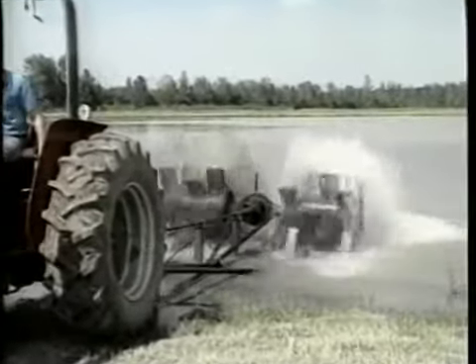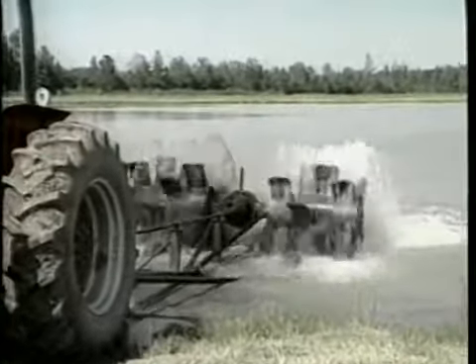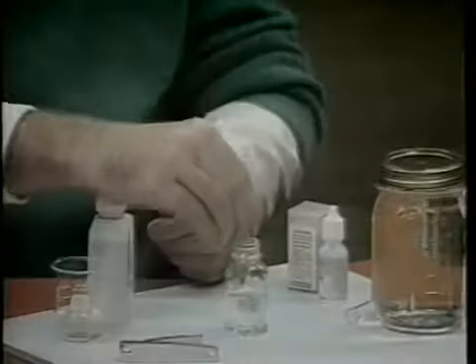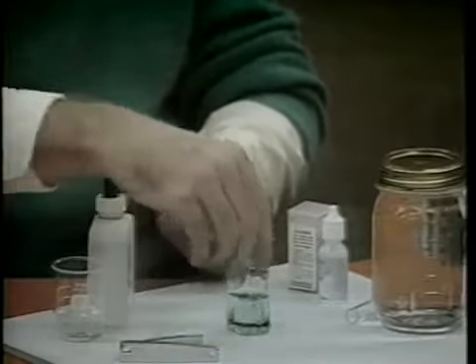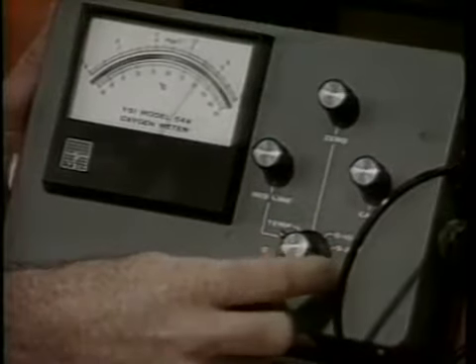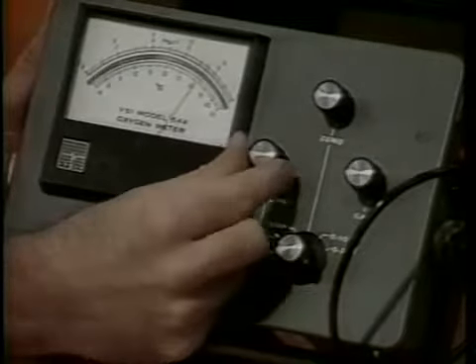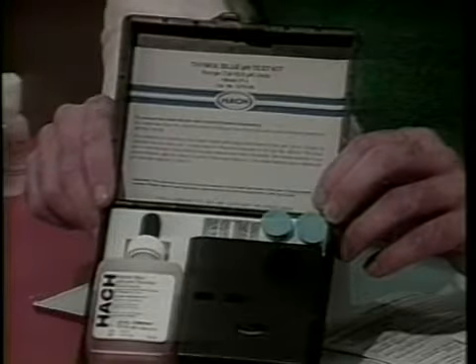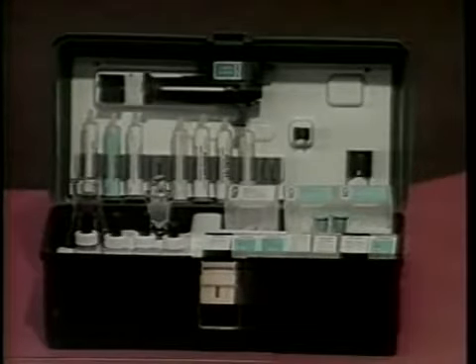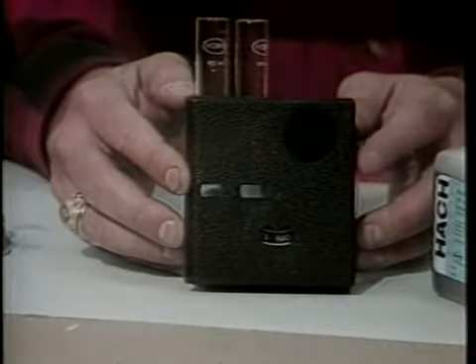Corrective measures for each parameter, if found to be at levels adverse to good fish production, will also be discussed. Testing procedures and corrective measures concerning total alkalinity and hardness were presented in tape 1 of this series. Throughout this video, water testing equipment such as kits and meters will be shown. Testing examples will employ a specific kit or meter simply for convenience. The producer of this video series does not endorse any of the particular kits or meters. Keep in mind that other kits and meters are available and procedures may differ slightly from the examples shown in this video.